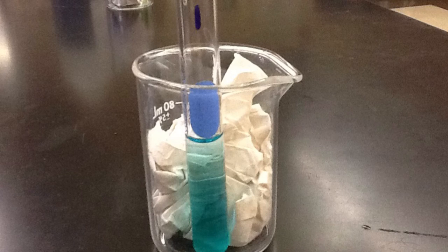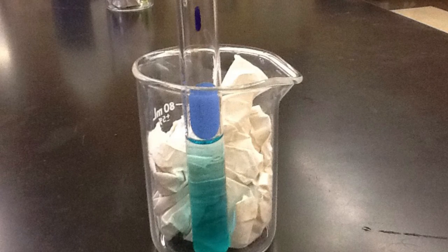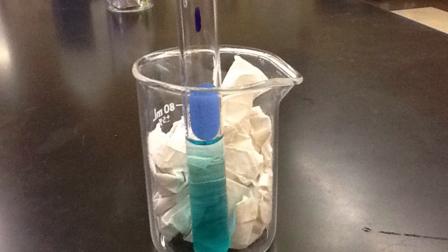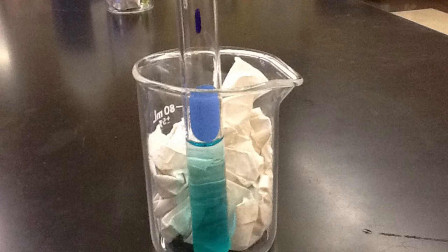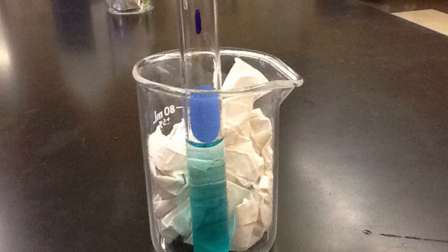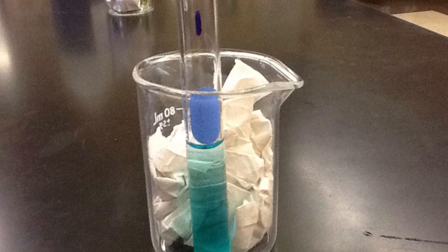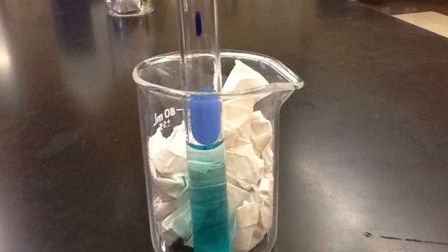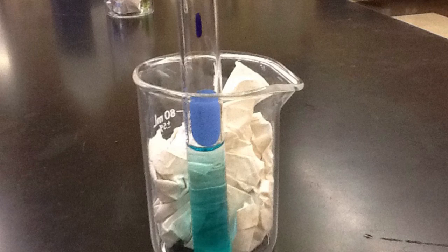So, what color would combine with blue to make aqua? Did you think of green? Good. Green and blue would combine to make aqua. And if you didn't think of that, that's okay, because you're going to get lots more practice. So, our prediction would be that the complex ion on the product side would be green. Go ahead and write green under that ion.